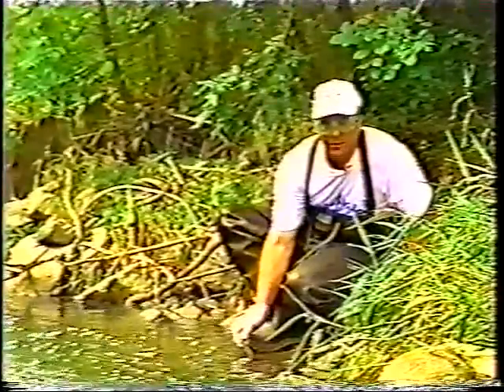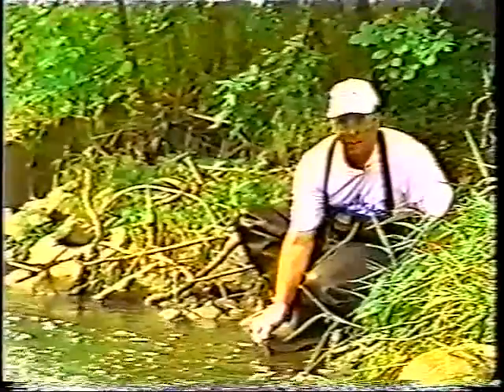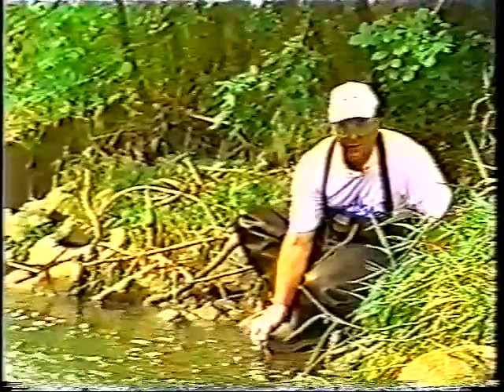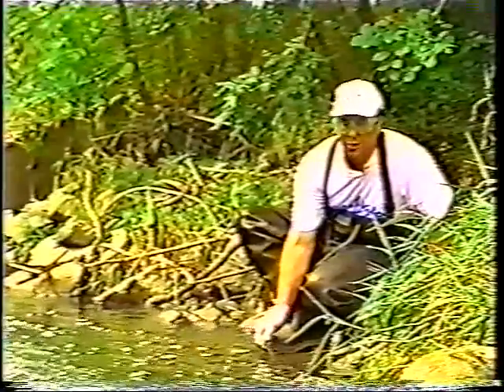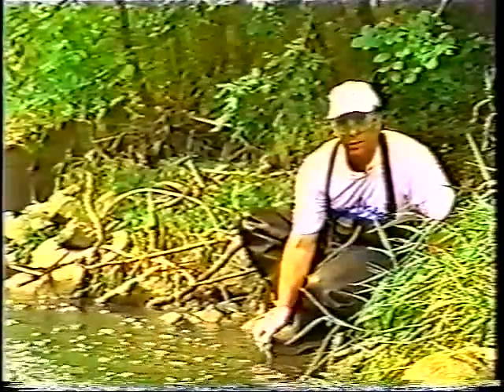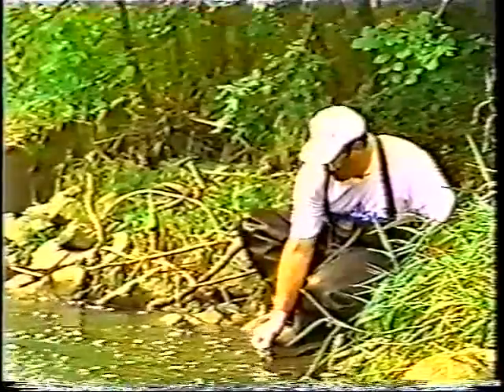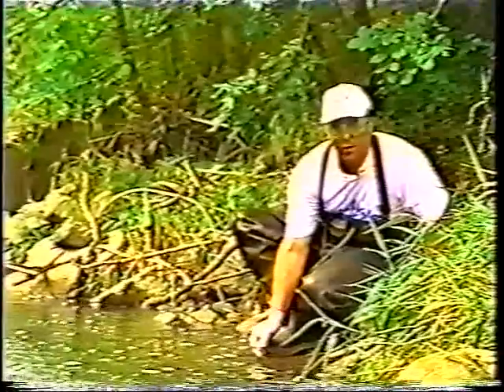So I know my thermometer is reading stable. It would probably be a good idea to bring more than one thermometer to the site when you test so that you can check the accuracy of the thermometers themselves. And you might want to check the accuracy of the thermometers back in the lab before you go to the site. These are the only sets of data that you need to collect for temperature while you're at the river.